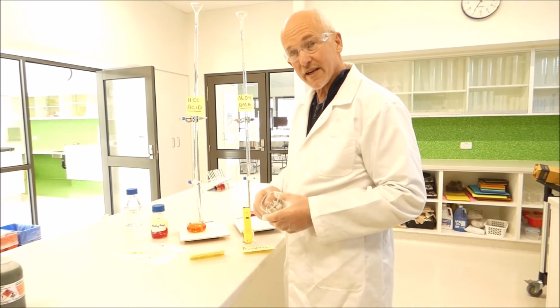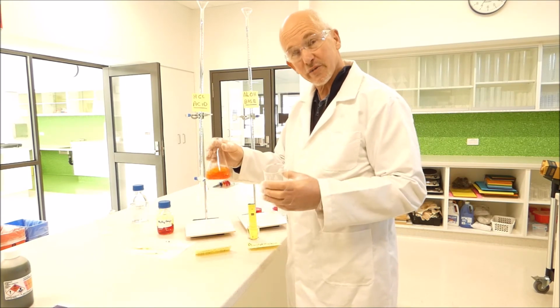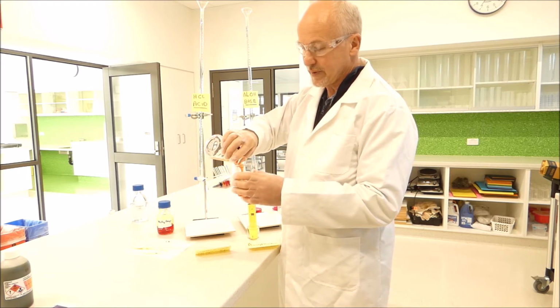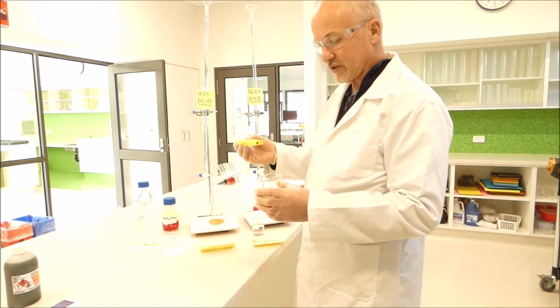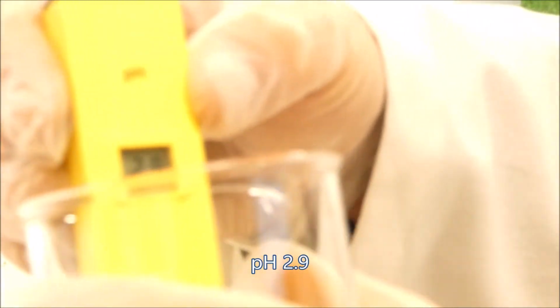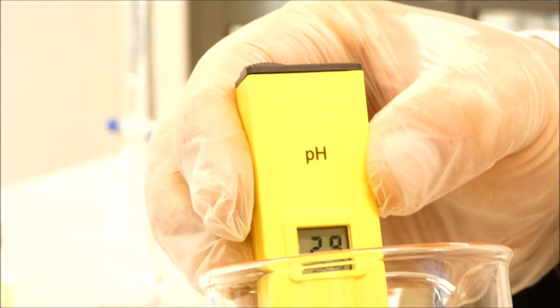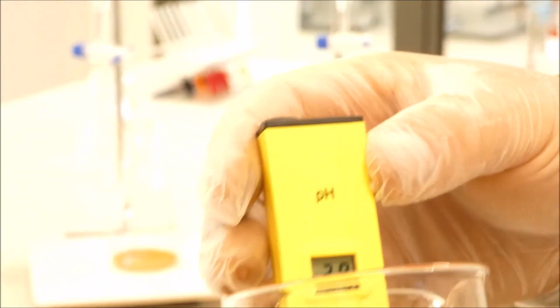So as we did before, we're going to test the methyl orange that we've just tested with our indicator to see whether the pH corresponds with what the indicator should say it is. So we'll pour the methyl orange solution into a beaker. We'll get our pH meter, which is reading about 7.6 in distilled water, and we'll place it into the solution. We'll give it a swirl around. We might have gone a little bit past our endpoint, but you can probably see there, it's reading about 2.9 in this solution, which is a little bit lower than the expected 3.2, but not far. So we went a little bit past the endpoint.